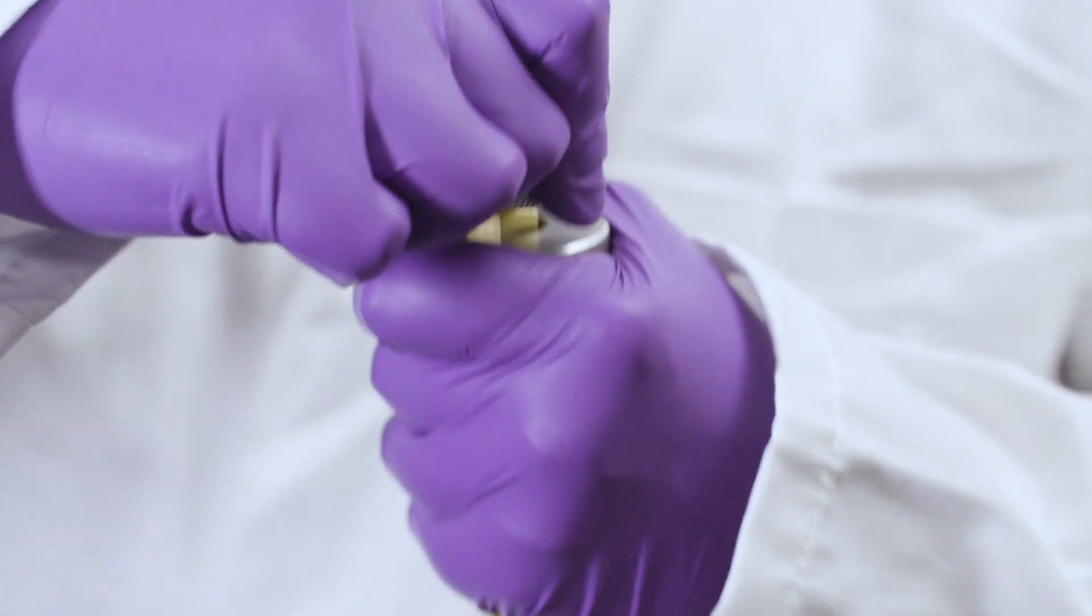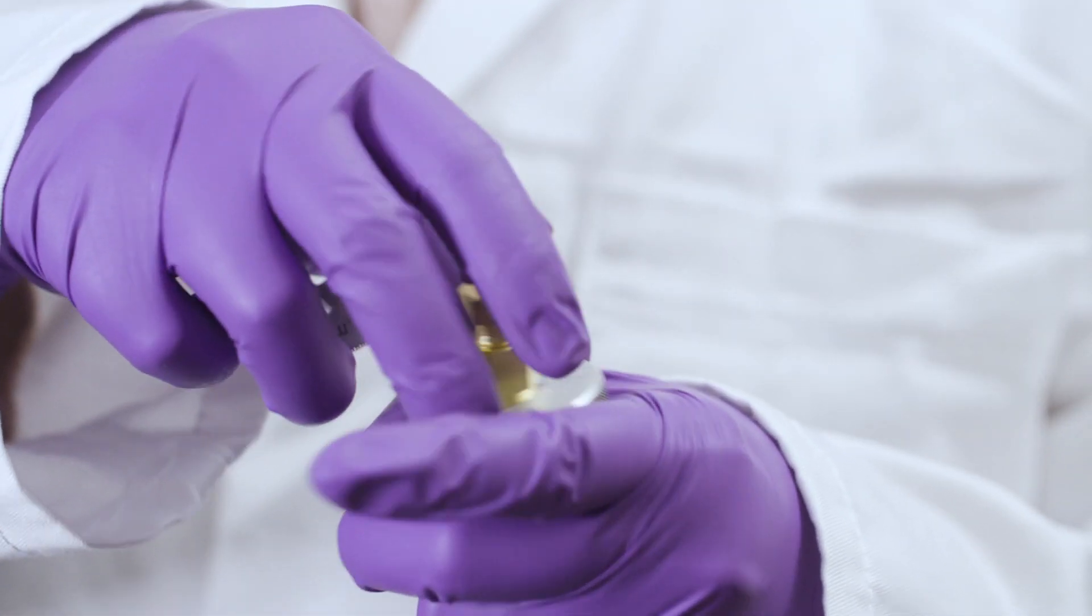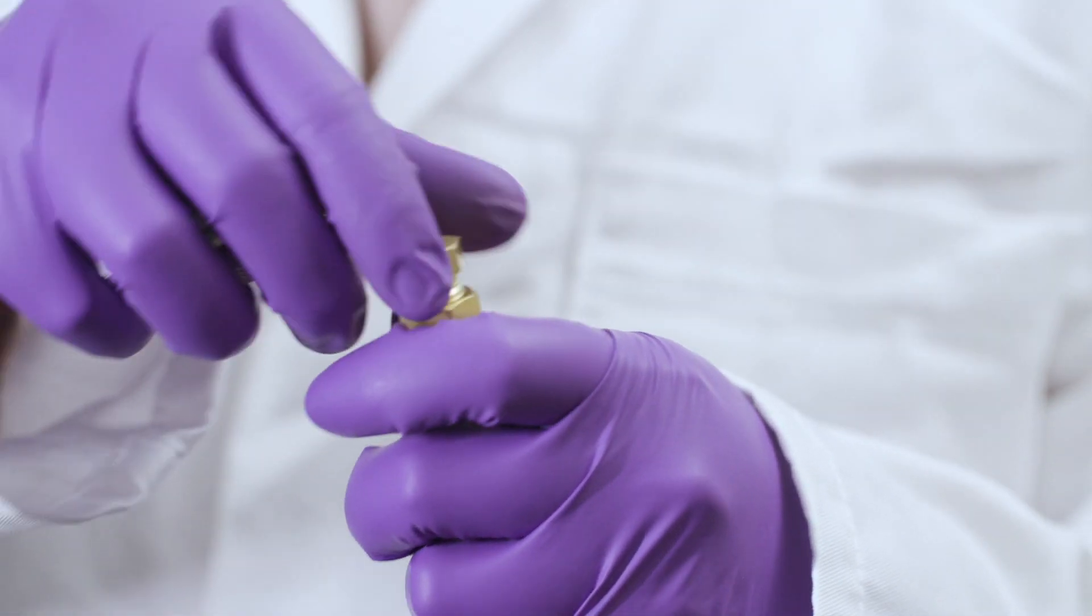To uncap sorbent tubes, follow the procedure in reverse order, quarter turning in an anti-clockwise motion.